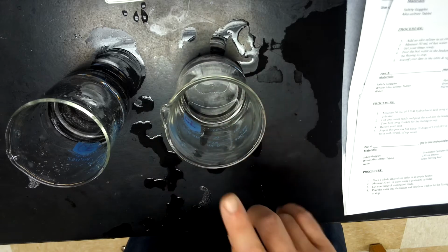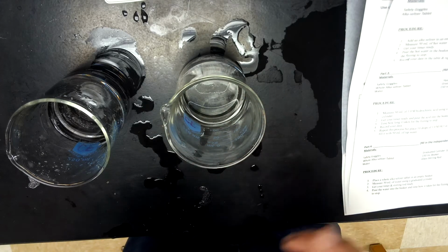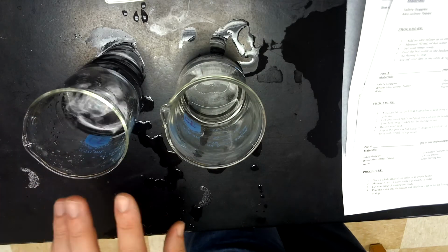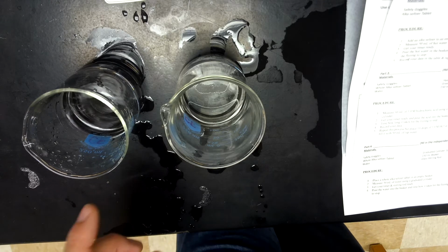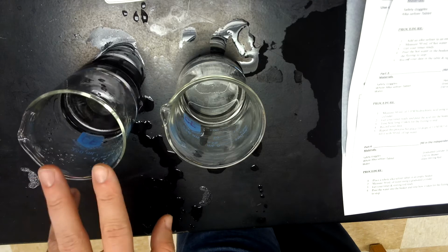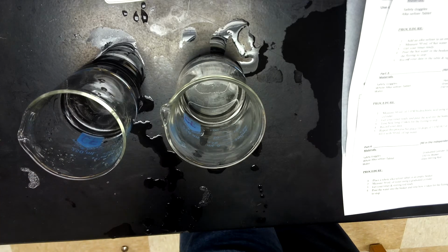On your sheet, it says 1 molar. I'm actually cheating here a little bit. I did 2 molar since I'm all alone. Can do a little bit more dangerous. And then this is a diluted hydrochloric acid. It's around 0.1 molar. So it's 2, am I doing this conversion right? 10, 20 times less concentrated, but it is still an acid compared to our water.